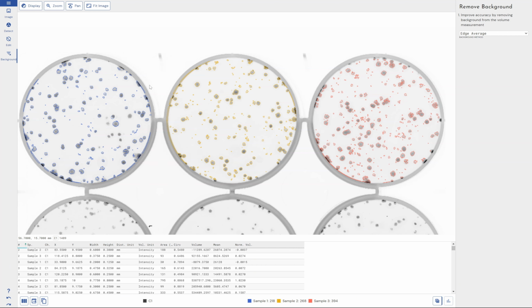But you can see that within a matter of, I don't know how long this video is going to be, maybe 7 minutes, we're able to start building up quite accurate spot number counts for our ELISpot experiments, making the analysis portion of the experiment very quick, very automated, and very reproducible. If you've got lots of operators, you define a specific workflow, specific imager, specific sensitivity for spot detection, you can really normalize this procedure if you're doing a lot of these and try and automate it as much as possible.